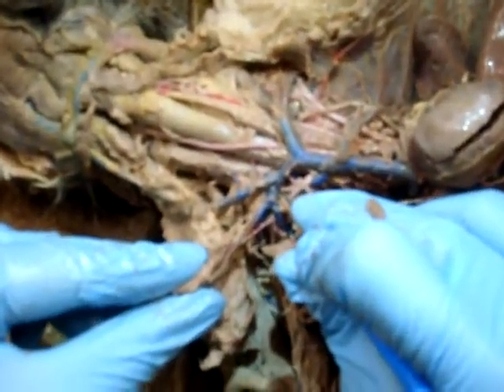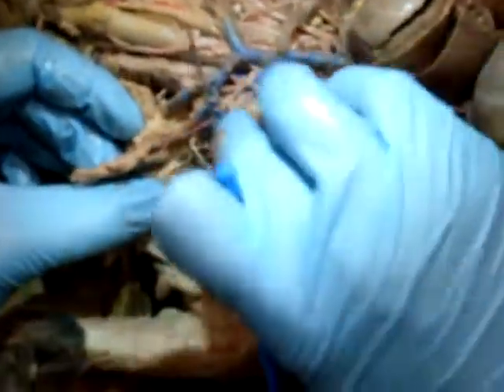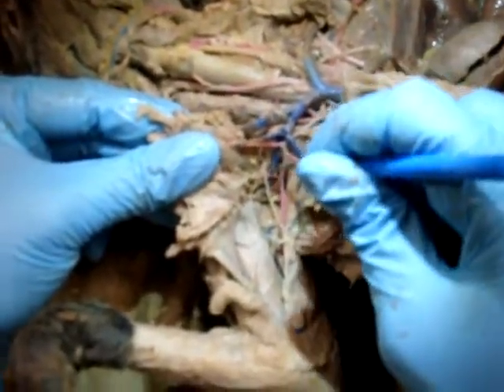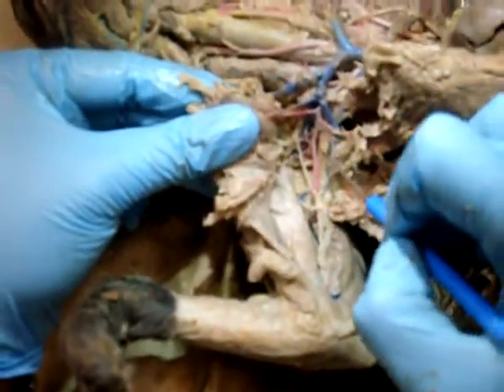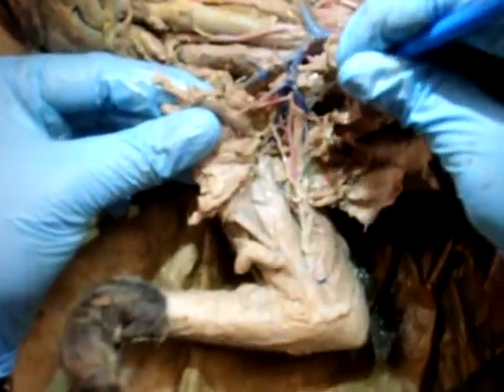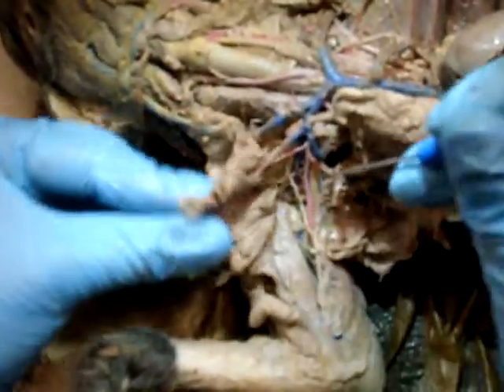Okay? Next. Axillary. Of course then you have the axillary, which goes right here, and then you have the subscapular, which goes down there. So axillary, these are way bigger, because the veins are thin and a lot easier to see than the arteries, which are smaller and thin. So that would be the axillary, because it's going to the armpit. This is going underneath, subscapular.